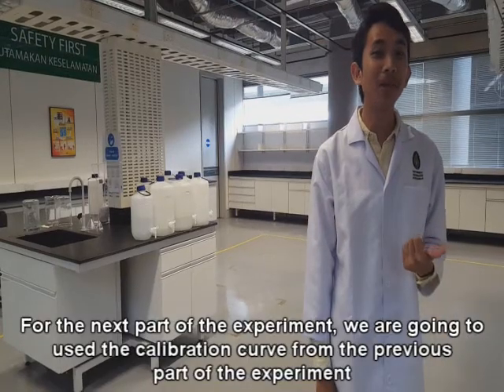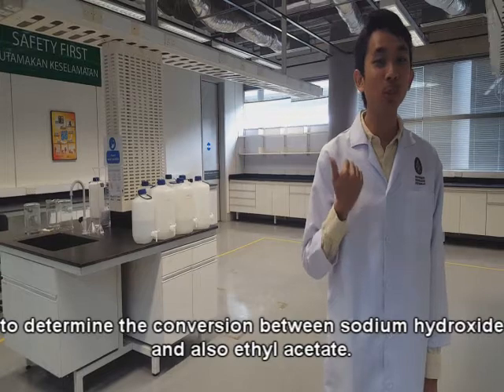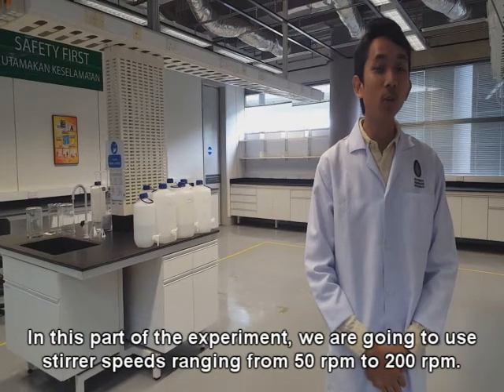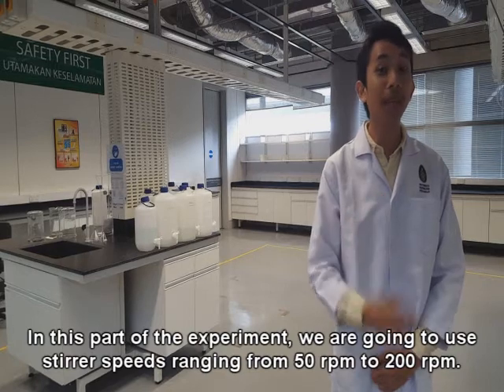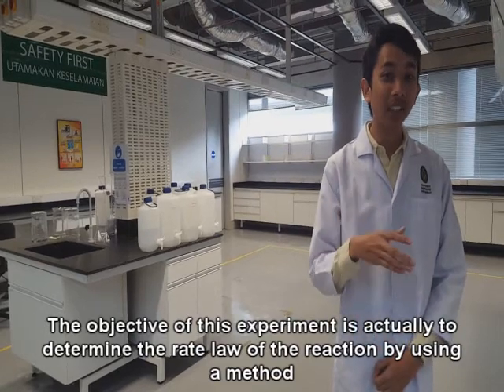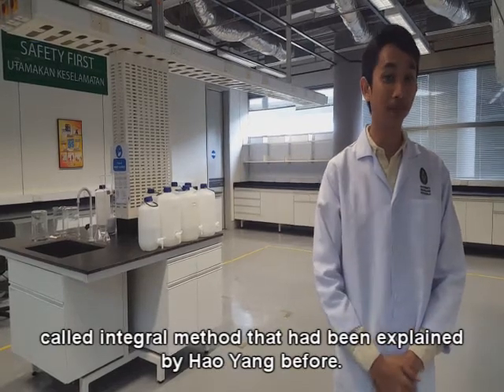In this part of the experiment, we are going to use the calibration curve from the previous part of the experiment to determine the conversion between sodium hydroxide and also ethyl acetate. We are going to use stirrer speeds ranging from 50 rpm to 200 rpm. The objective of the experiment is actually to determine the rate law of the reaction by using a method called the integral method that had been explained by Hao Yang before.